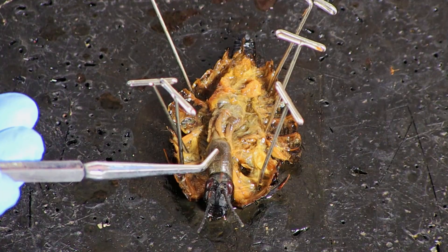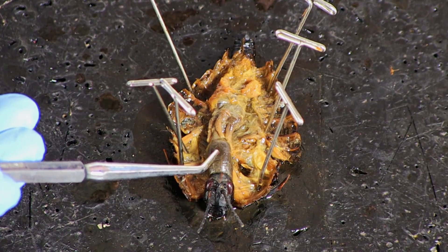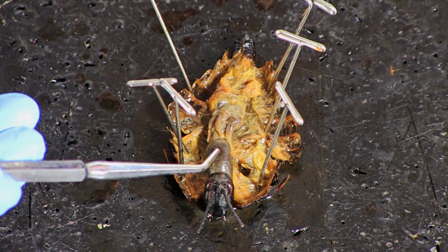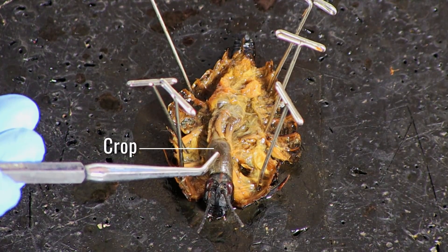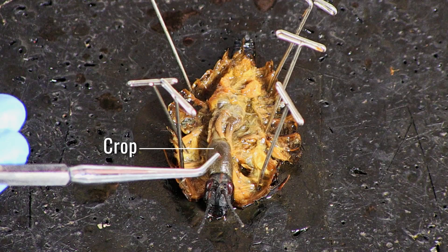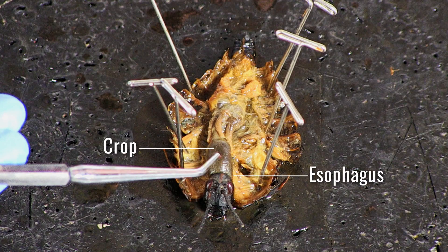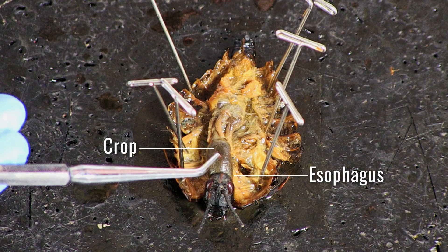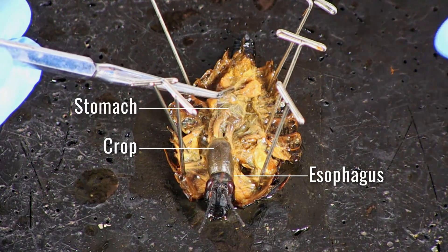The large conspicuous structure that fills most of the thoracic region is the crop. The crop stores food temporarily. Take a picture and label the crop. Anterior to the crop is the esophagus. Posterior to the crop is the stomach.